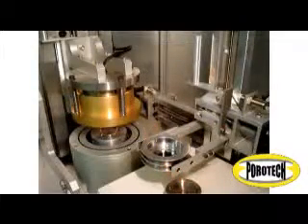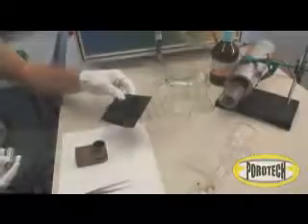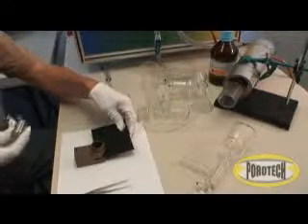The following is a demonstration that will allow you to see the operation of our third generation automated porosimeter, the Standard 3.1. Prior to launching the machine, there are several steps required to prepare the sample to be tested.